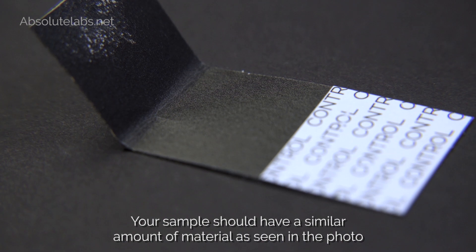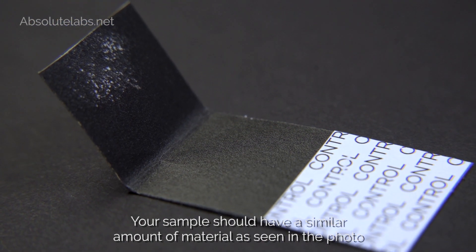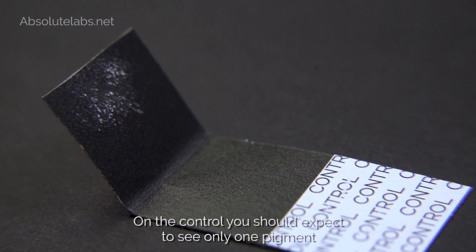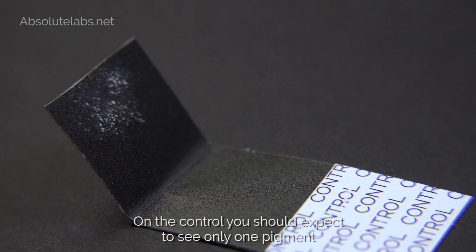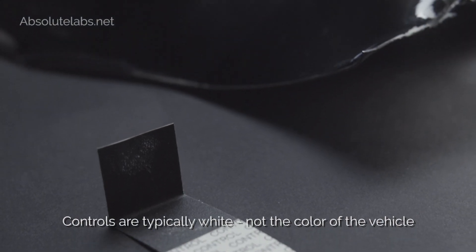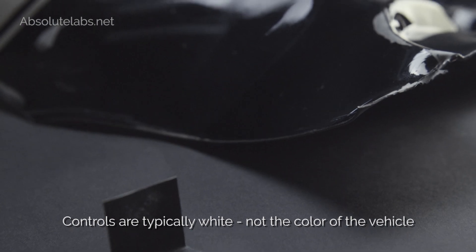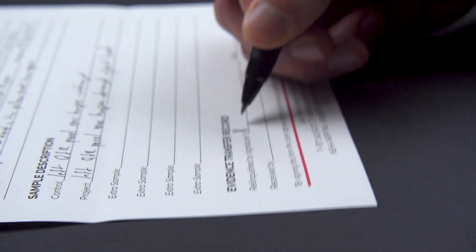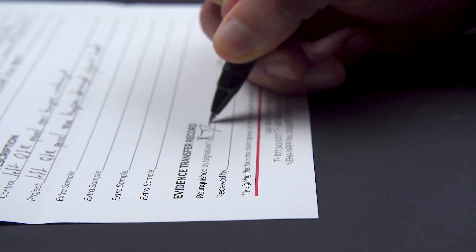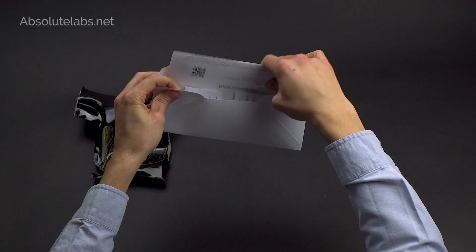Your sample should have a similar amount of material as seen in the photo. On the control, you should expect to see only one pigment. Controls are typically white, not the color of the vehicle. Complete the chain of custody form. Be certain to sign and date the relinquished by section of the form.